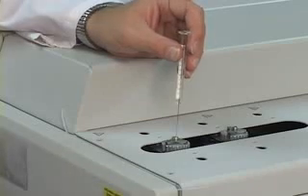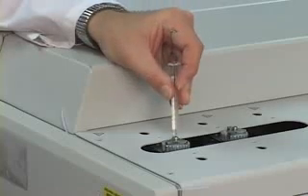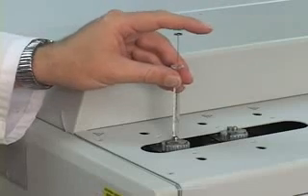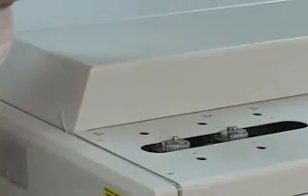We will inject the sample and initiate the run simultaneously. Force the syringe through the septum — it will feel some resistance, but force it through and rest upon the tripod. Then inject the sample and trigger the run simultaneously, and then remove the syringe from the GC.